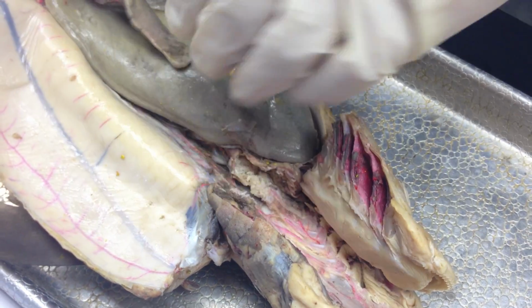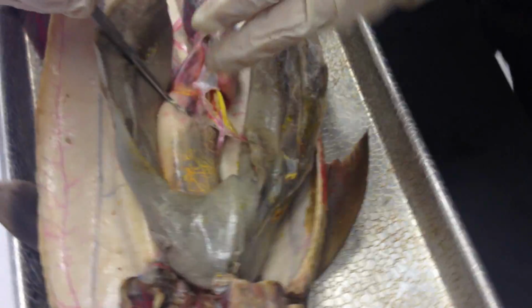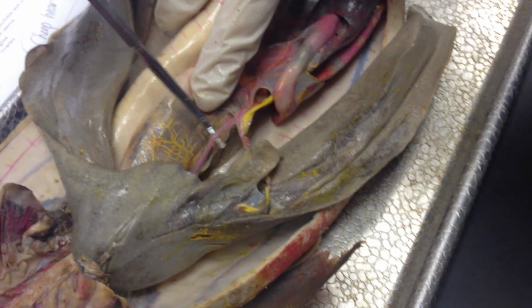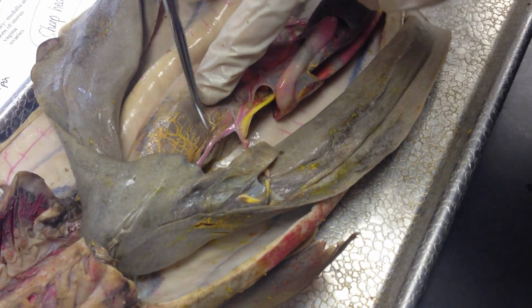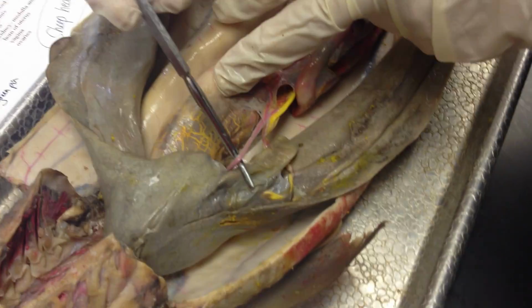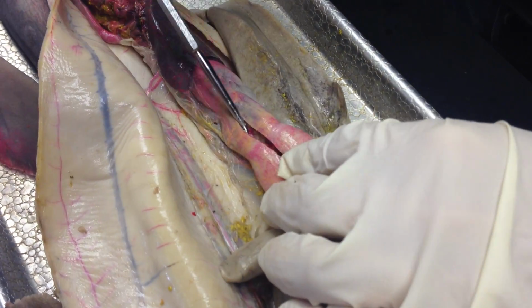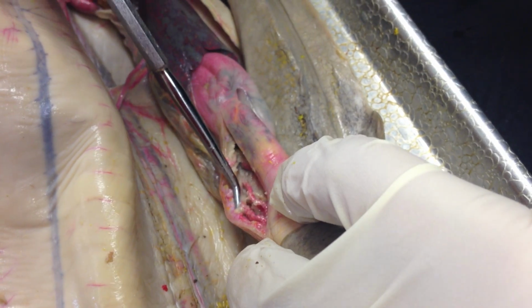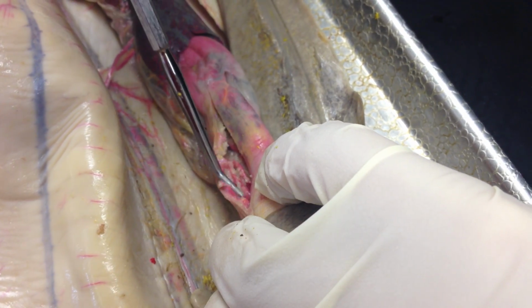The celiac artery and trunk. This is the celiac artery. And where would the celiac trunk be? It's the same thing. Same thing, right, okay. The stomach has rugae inside of it, which is, if you can see here, the dissected stomach. Rugae are the folds that are reddish here.